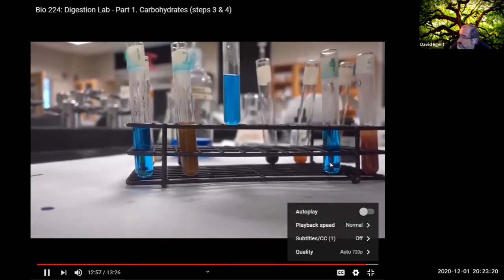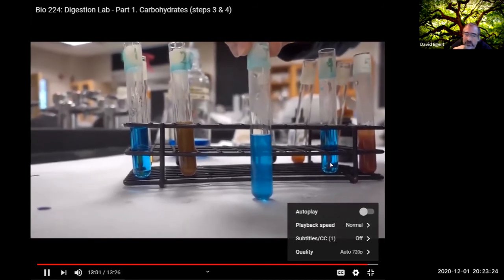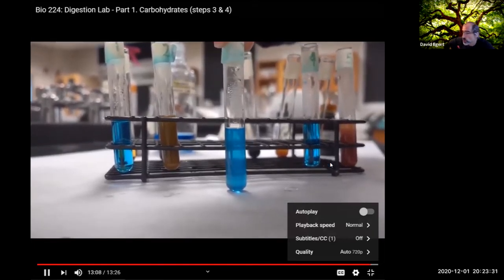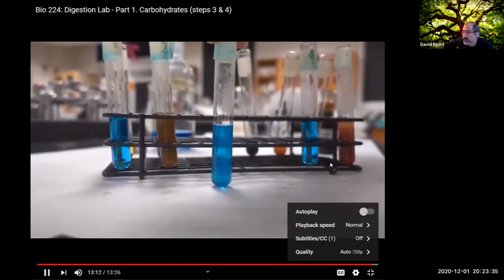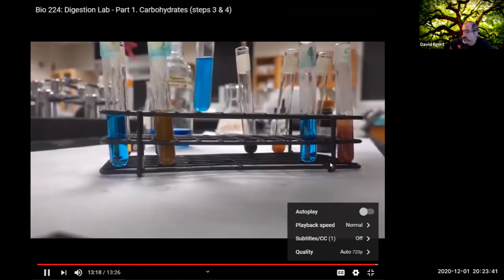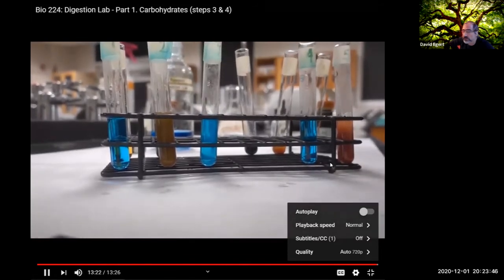These were both exactly the same, except in 3 we had the concentrated hydrochloric acid in ahead of schedule, before we put in the amylase. So the enzyme ended up having to try to do its job under this really low pH condition, and we can see a very different result. Definitely something you want to think about and discuss.